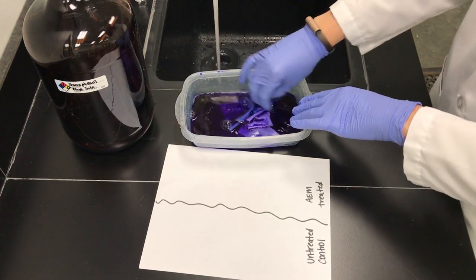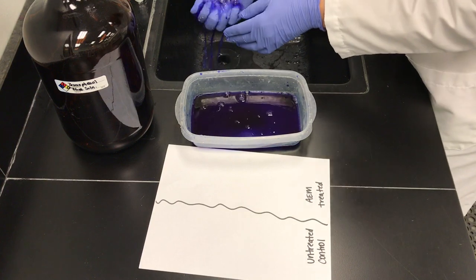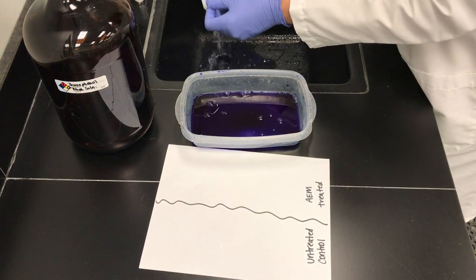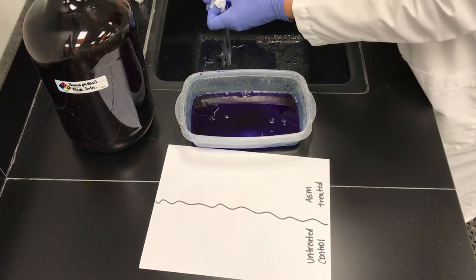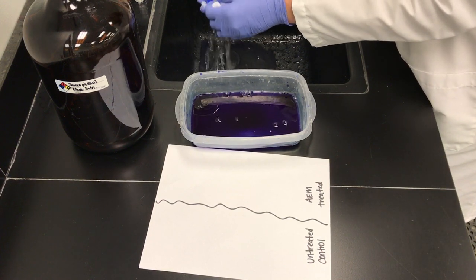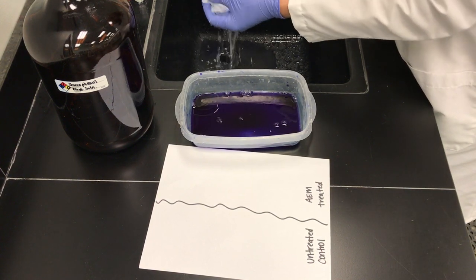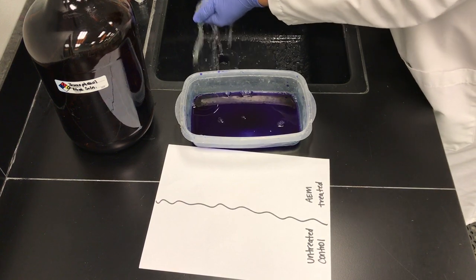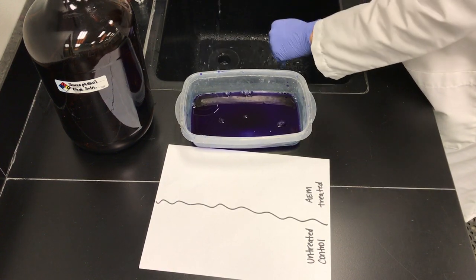Once the sample is done soaking, rinse with a copious amount of water.